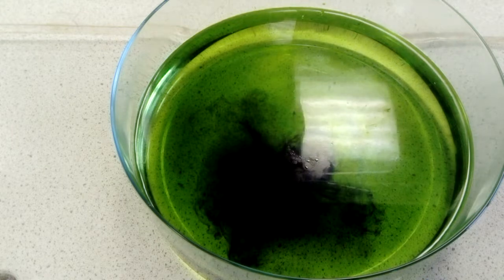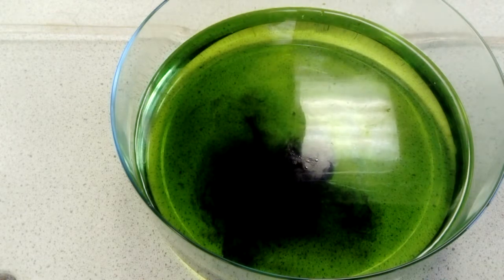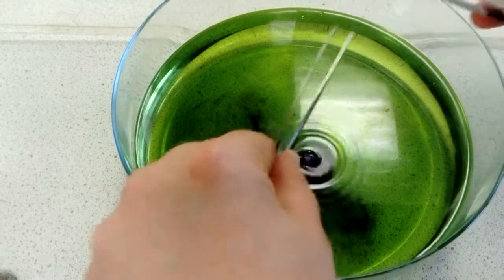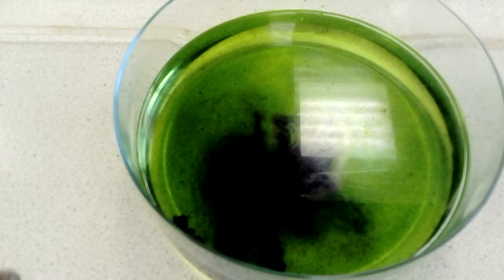At the same time, it's important that we only put in a tiny amount. If you put in too much, it goes over something, and a proper chemist would probably be able to explain this better than I can. It goes over something called critical mass, and it won't just fizz around on the top, it would explode. So if we drop in our sodium, you can see the sodium fizzing around on the surface. It's heated up that much, so we've got a nice molten ball of it at the surface. It's more reactive than lithium was.